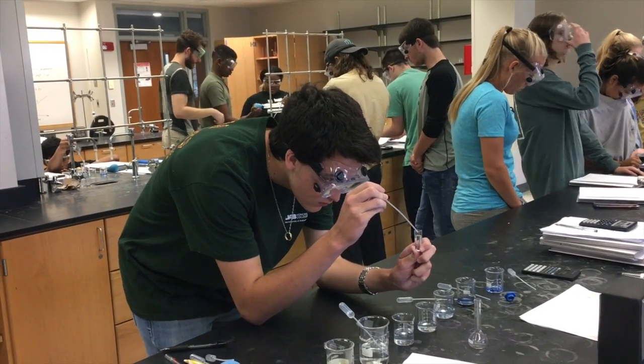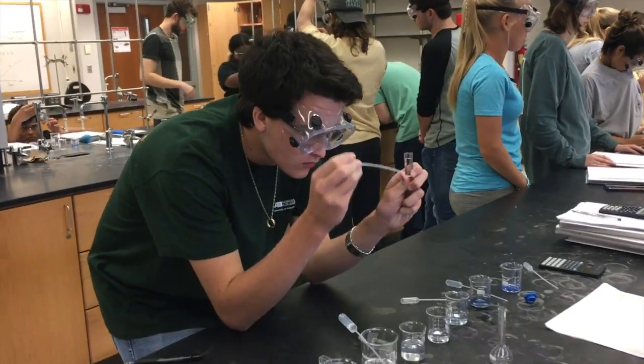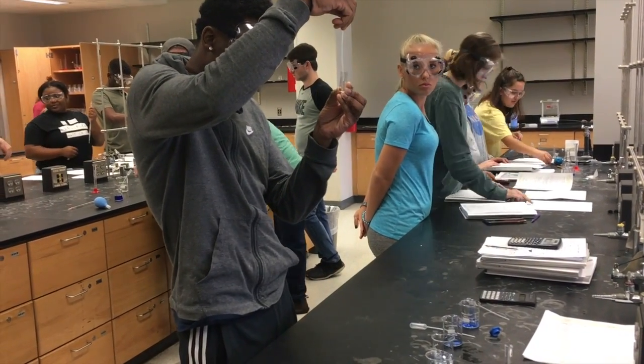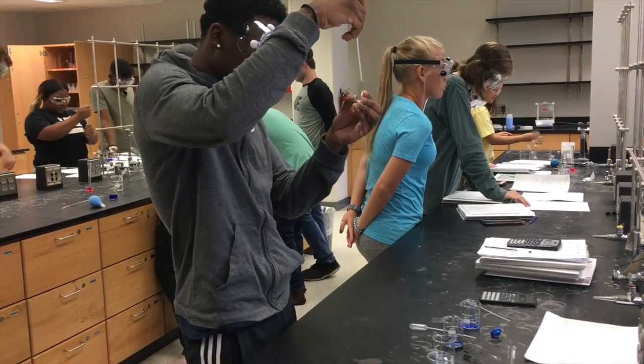Lambda max is found to be the x value on the graph when the y value is at its max, and defined to be the optimal wavelength for the stock solution. The concentration can be found using stoichiometry after completing the dilutions of your stock solution.